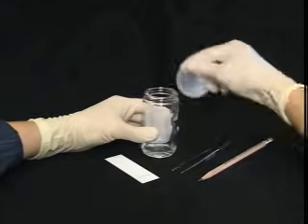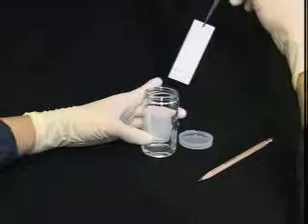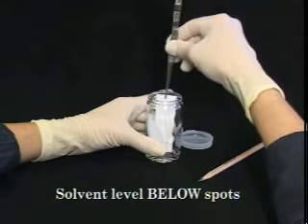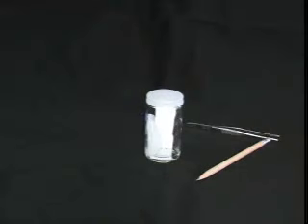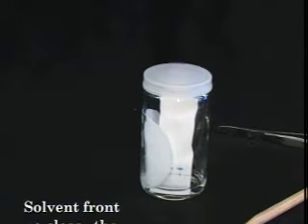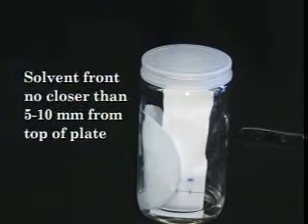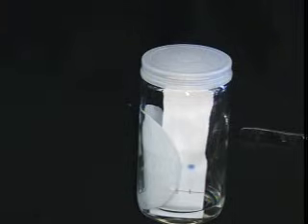Once you have applied your sample and the spots have dried, it's time to develop the plate. Using your tweezers, pick up the plate and place it in the developing chamber. Make sure that the solvent level is below the spots on the plate, otherwise you will end up with your sample dissolved in the developing solvent. Replace the cap to prevent evaporation of solvent off of the plate, and try not to let the edges of the plate touch the filter paper, as this will disturb the capillary motion of the solvent on the plate. Keep a close eye on the solvent front — do not let the solvent get closer than 5 to 10 millimeters from the top of the plate. When the solvent front gets too close to the top, evaporation becomes a problem and the spots keep moving up the plate, but the solvent front appears to stop, leading to incorrect RF values.